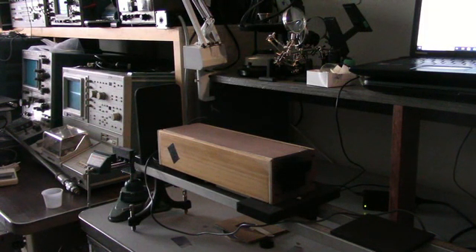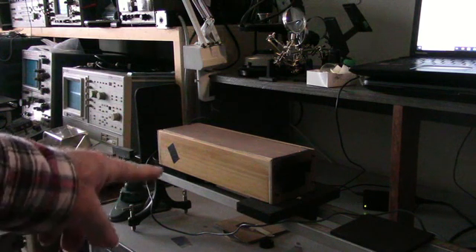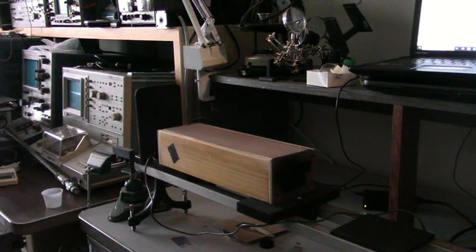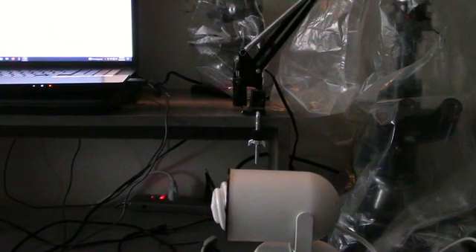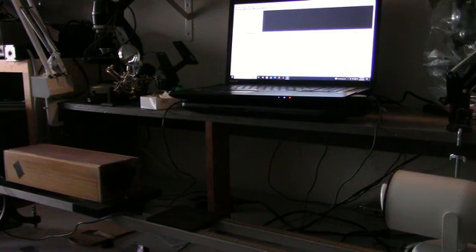Here's a demonstration of the spectrometer, which is located here on the optics bench. What I have in this lamp holder is a compact fluorescent lamp. The display on the computer here is the software that allows us to use this homebrewed spectrometer. Kind of crude, but it tends to work. I'll show you in a second. I'm going to turn on the compact fluorescent lamp right now.